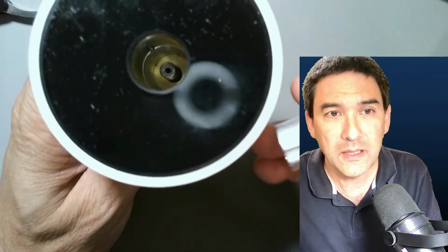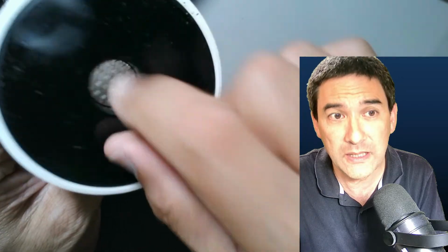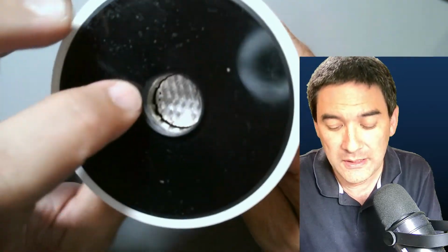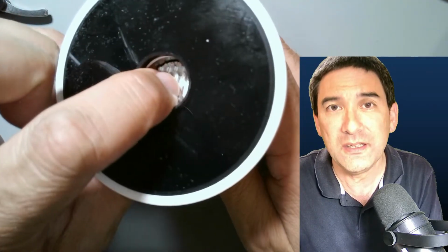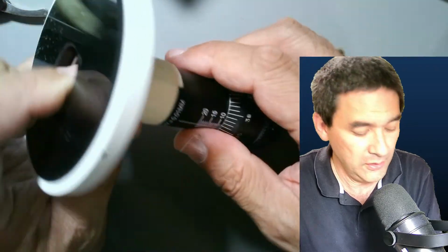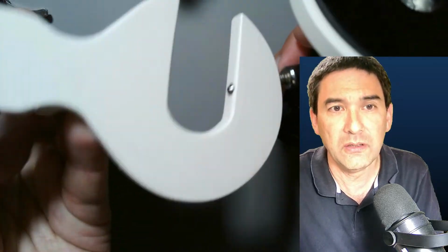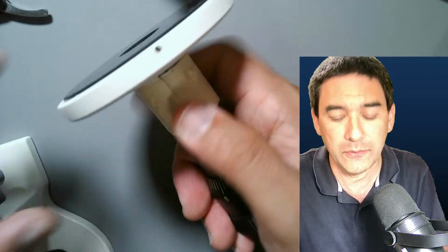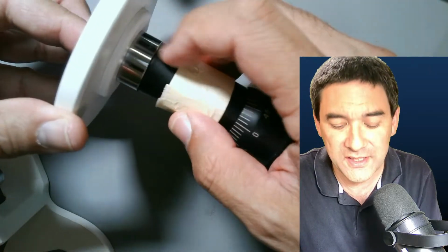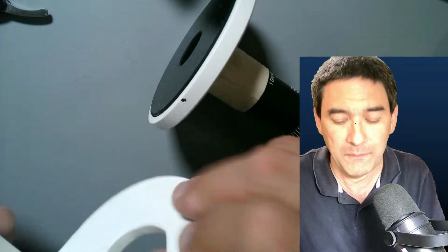Another one that I have is the one over here. You see there's a little piston in here as well, and this one just is dropped in here. There's no clamp, and the specimen is placed in here. It's also advanced using the wheel down here, and it can also be connected to the table using this clamp over here. I added a little bit of cardboard around here to prevent the table from being scratched by the screw on the side. So it also works.